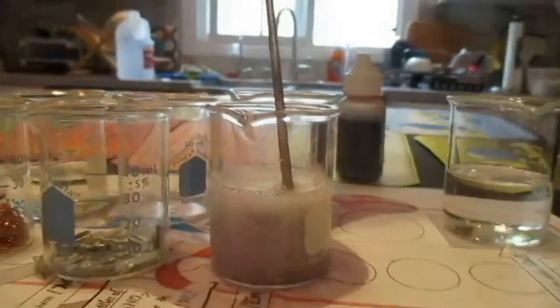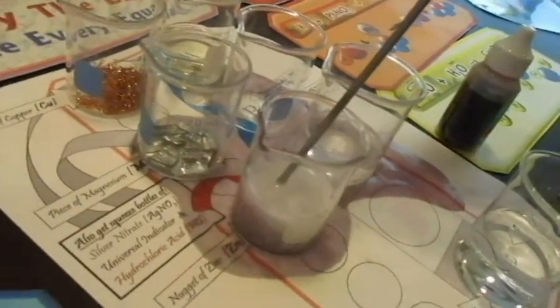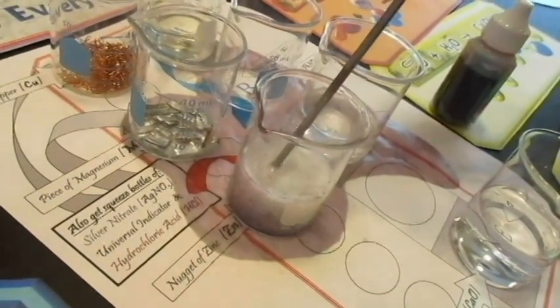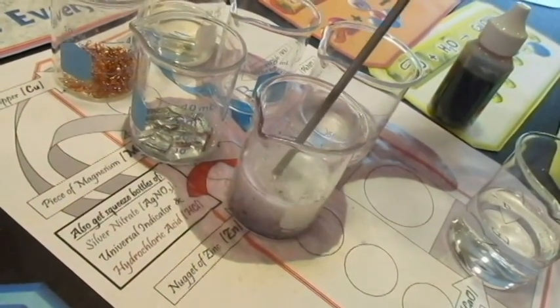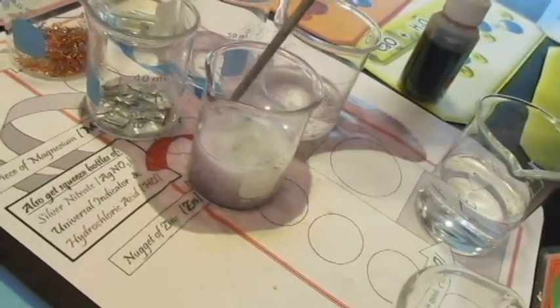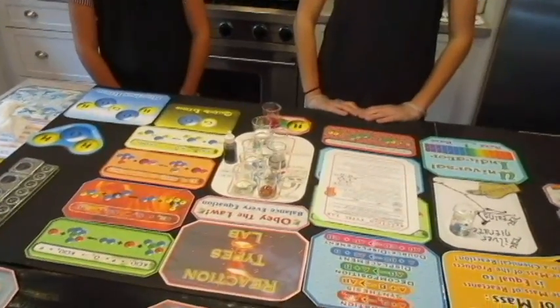Wow, hang on. So this is a good one. It's really going. We know whether the temperature went up or down. That's the main thing. And you know what I think I'll do? I think I'll just swap out the placard with a laminated placard. The reason I didn't is because of the reflection, but oh well. We've got laminated placards. Okay, now let's switch the paper.